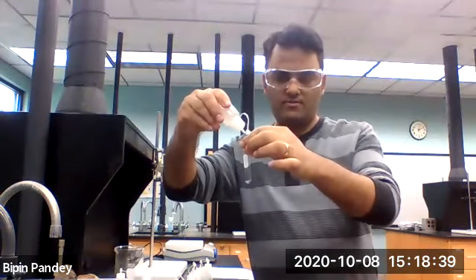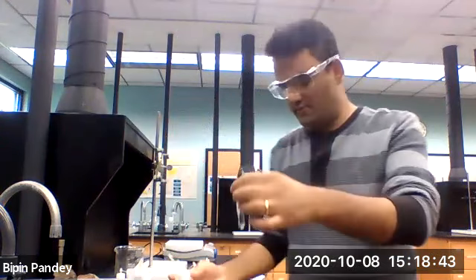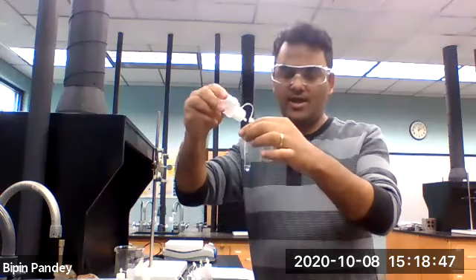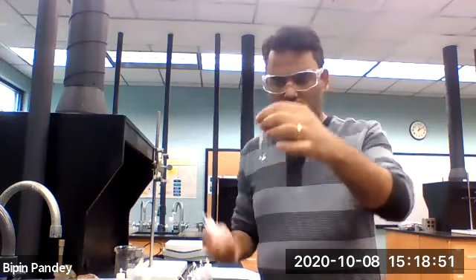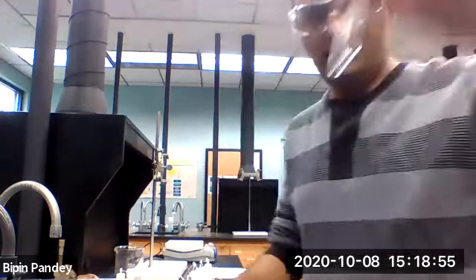Five drops of sodium chloride to get sodium cation. Use carbonate anion, carbonate 5 drops. Solution is clear, no reaction.